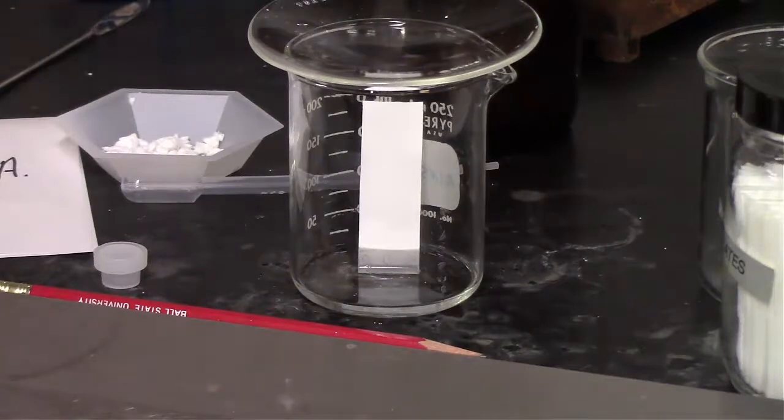So now that we have that, the solvent is actually running up the plate and pushing compounds up the plate depending on how well or how not well the compound interacts with the solvent and how strongly the compounds interact with the silica gel on the TLC plate. So for the TLC plate, if you have a very polar compound, that is going to have strong interactions with the silica gel on the plate, and it will not be pushed up as far.